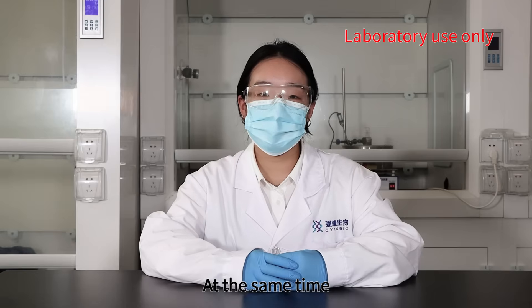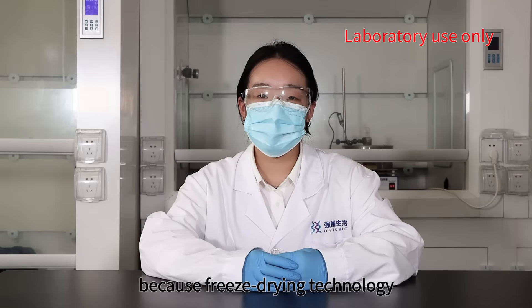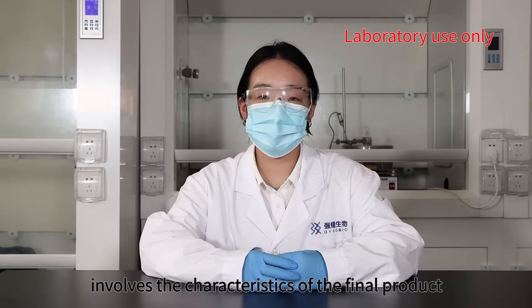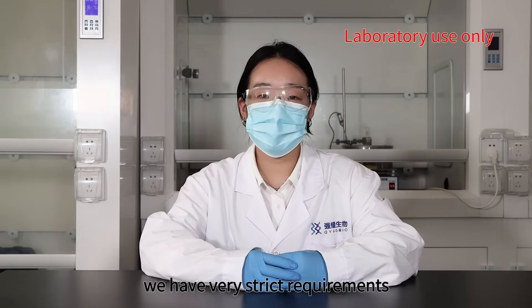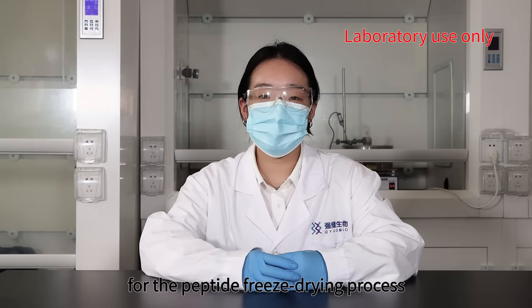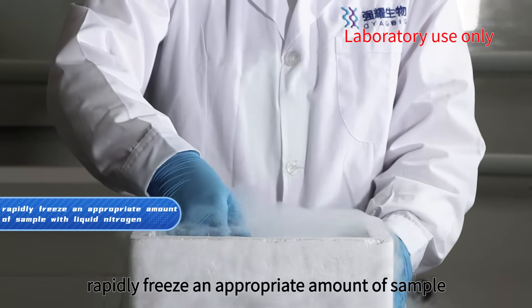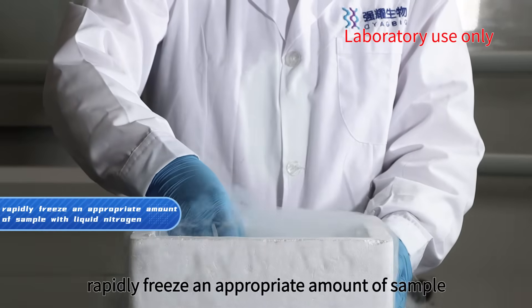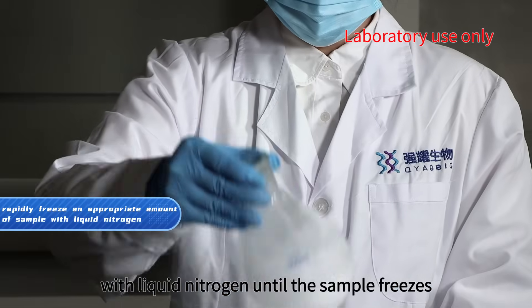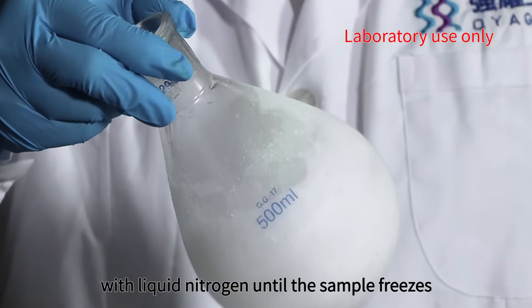At the same time, because freeze-drying technology involves the characteristics of the final product, we have very strict requirements for the peptide freeze-drying process. Firstly, rapidly freeze an appropriate amount of sample with liquid nitrogen until the sample freezes.